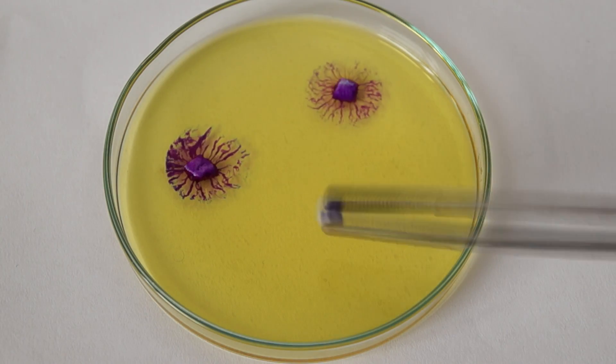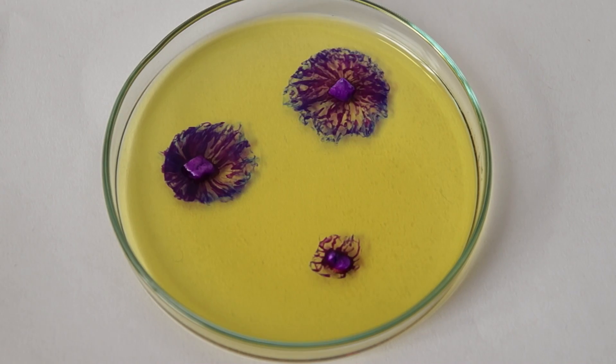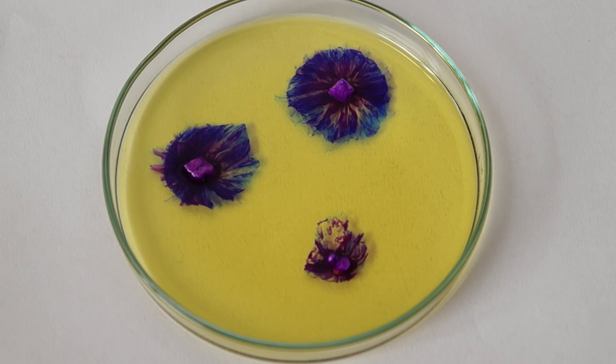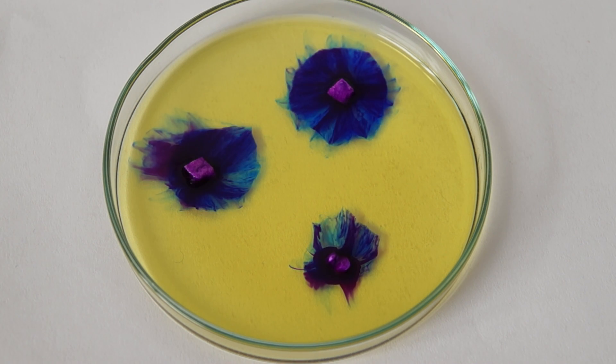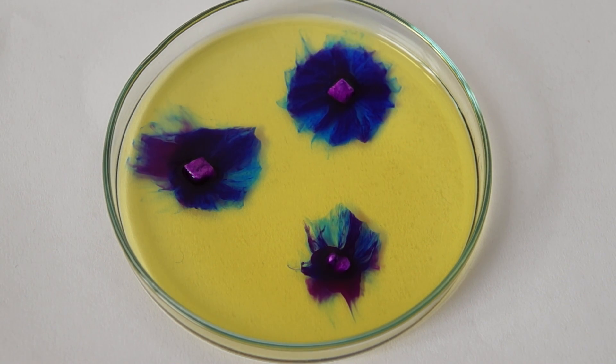And for this mixture I have opted for slightly different components. I took a bit of kerosene and ethanol, but the experiment turned out to be not so spectacular as the first one.